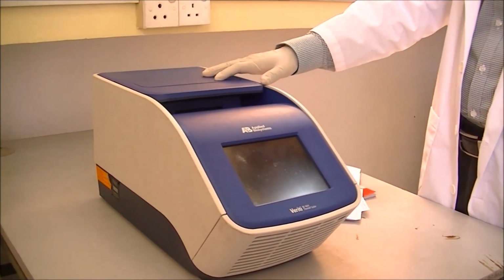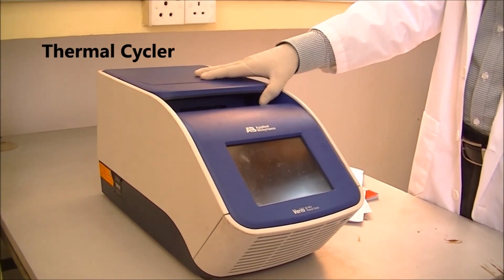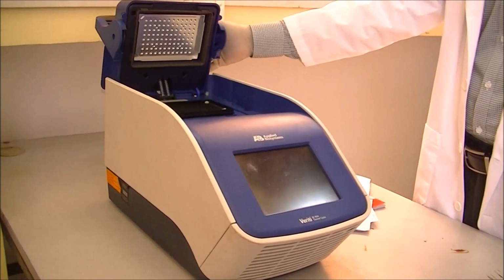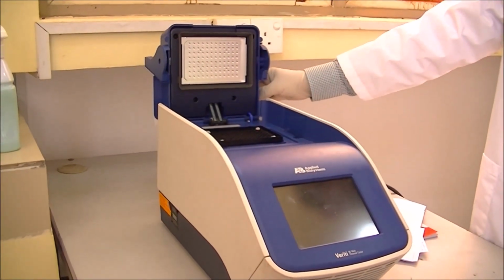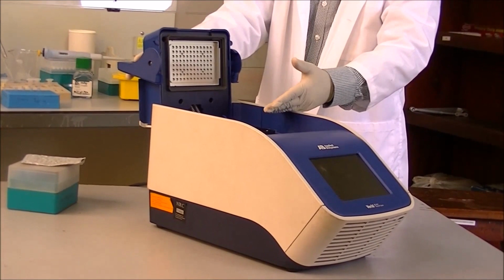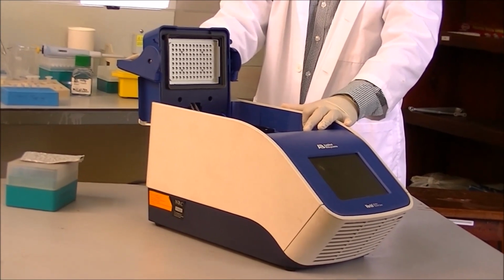Once the samples are prepared, they are placed in a machine like this. This machine is known as the thermal cycler, or commonly known as a PCR machine. This machine can be pre-programmed to hold certain temperatures for a certain period of time. Once the tubes are inside, the chemicals will gradually amplify the DNA template that we have inserted.